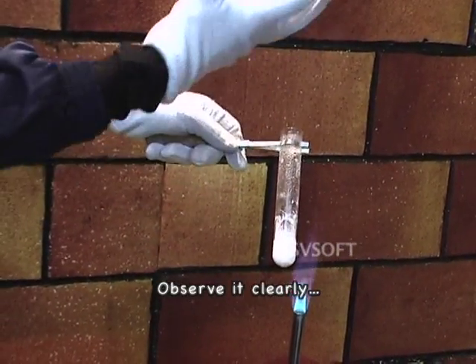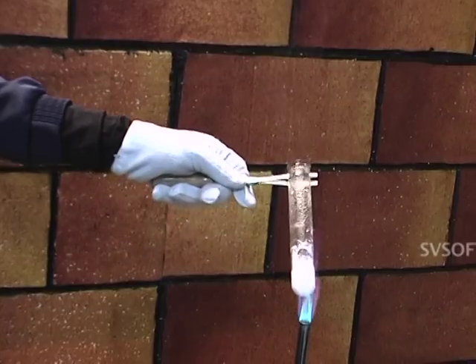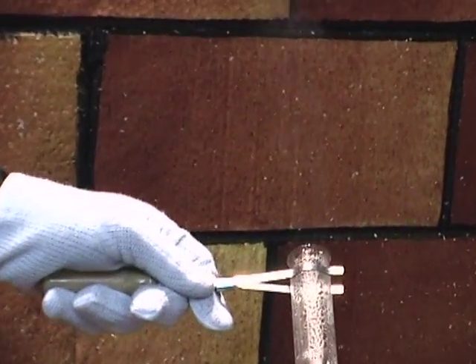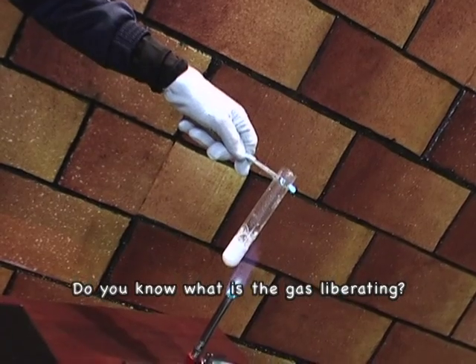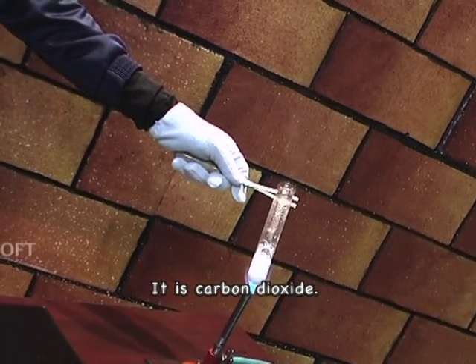Observe it clearly, gas is evolving, right? Do you know what is the gas liberating? It is carbon dioxide.